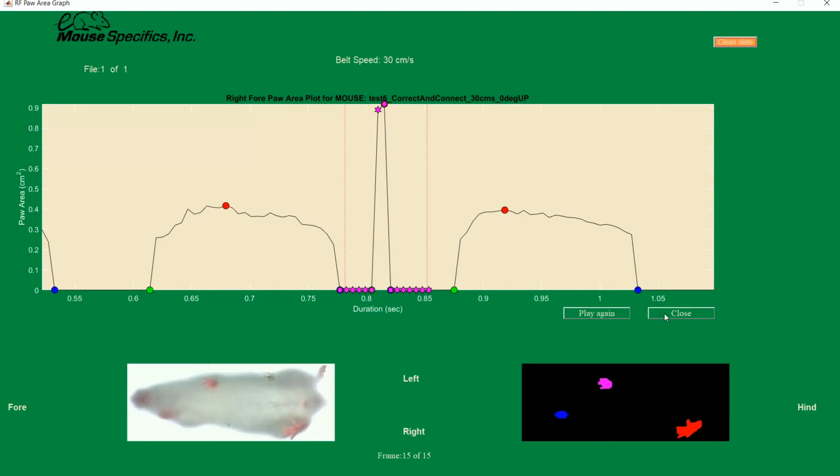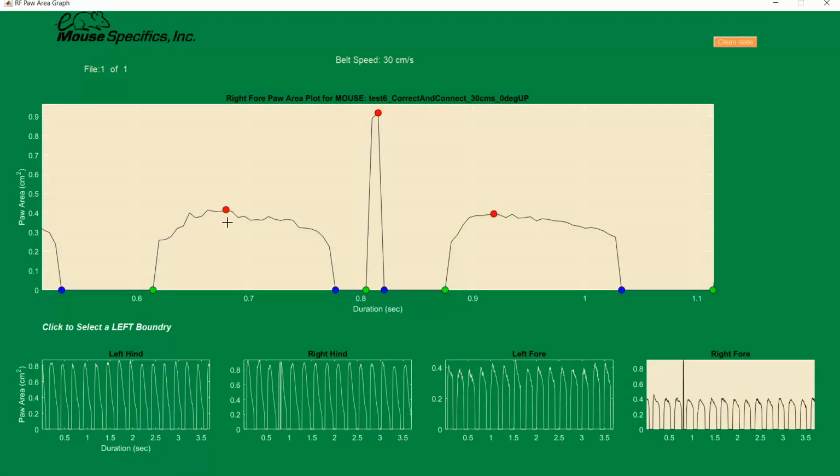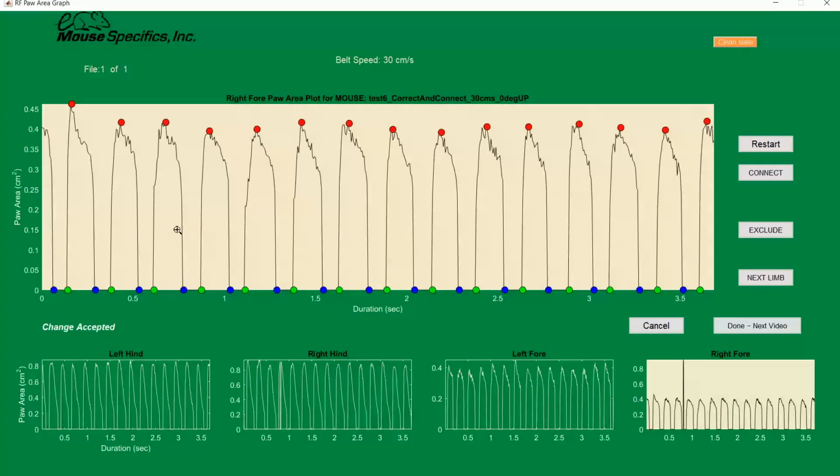To do this, we'll use the correct editing feature. To edit this noise, we're going to close out of the play video feature and then click on correct. Then we'll click once to zoom in on the area of interest, and then click once to the left of the green dot that begins the false peak, and once to the right of the blue dot that ends the false peak. This highlights the noise and indicates to the software that we want to change this from stance to swing. Since there is nothing else we want to edit, we can select No on the pop-up and our signals have been edited properly. Notice how we no longer have that peak in stance phase, but the length of our signals remains unchanged.